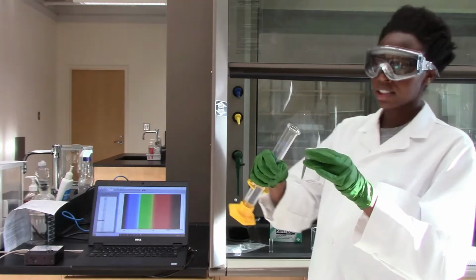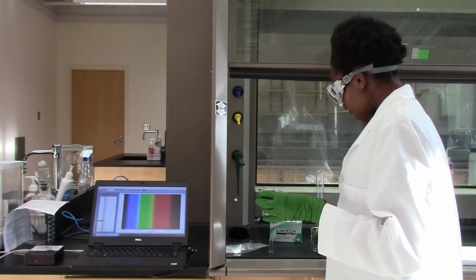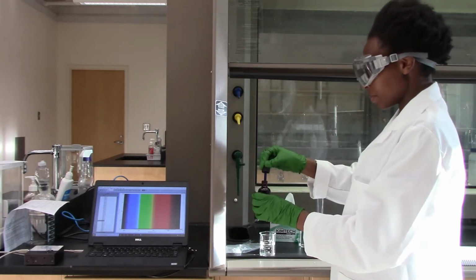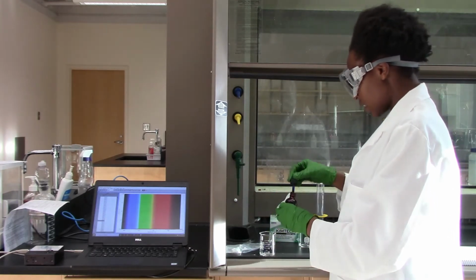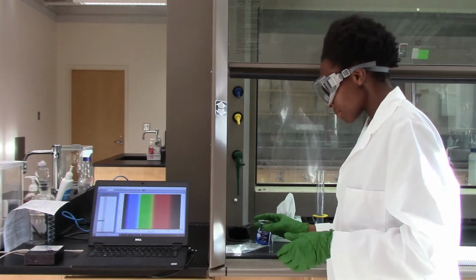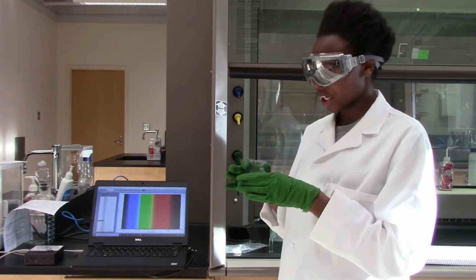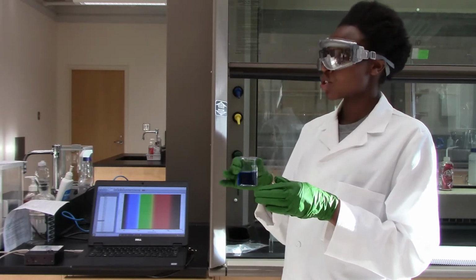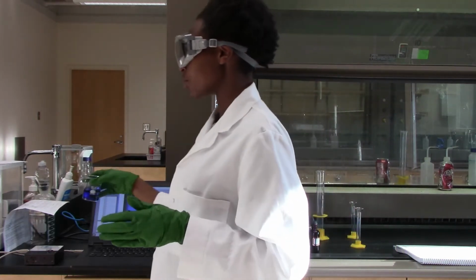And also to make my dye concentration, I'm going to take 50 milliliters of water. This is deionized water, and then I'll add a drop or 2 of my dye, and I will mix it. And so to get to the right concentration, I have to keep taking the absorbance readings so that I have an absorbance reading of between 1.5 and 2. So I'm going to use a spectrometer for that.